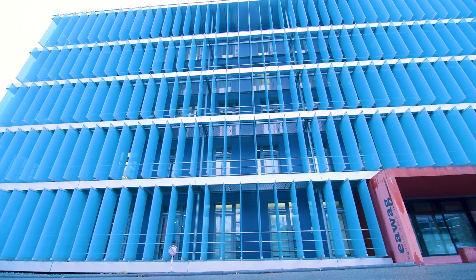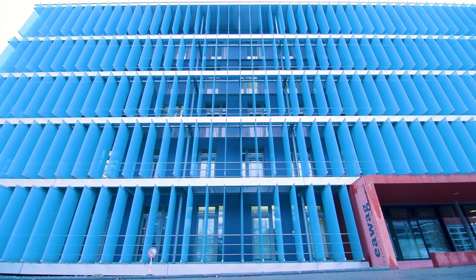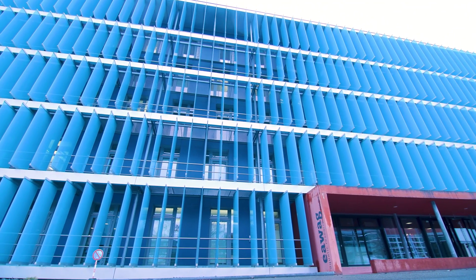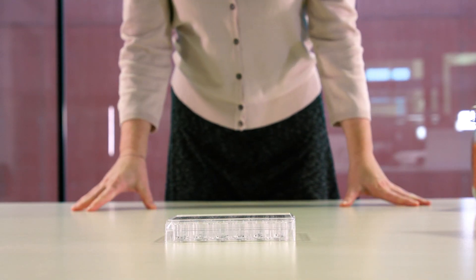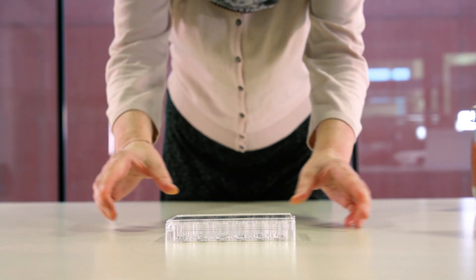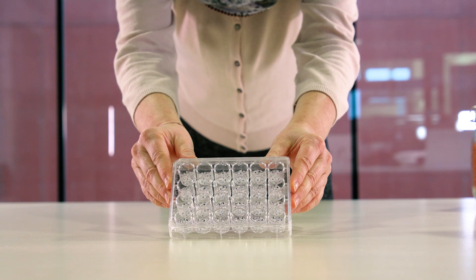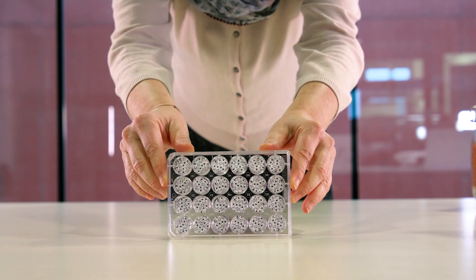We at EAWAG thought there must be a better solution. Actually, we do not need fish anymore. Instead of fish, we now use cells which were once isolated from fish and which we can culture in the laboratory indefinitely. We place these cells into tiny containers which substitute the aquaria.